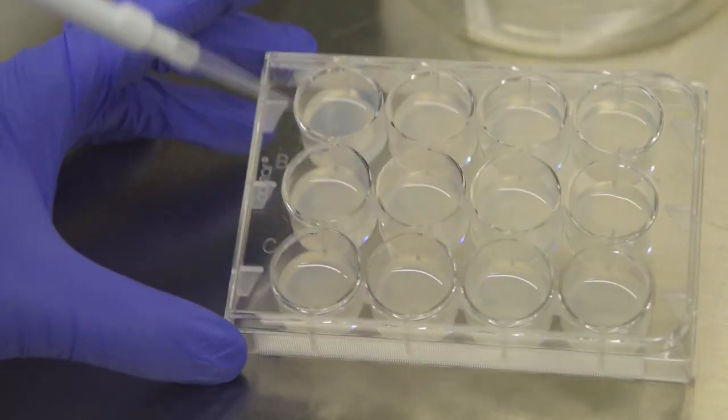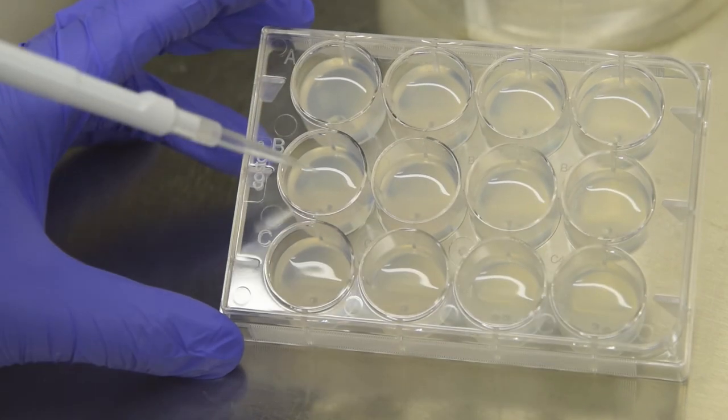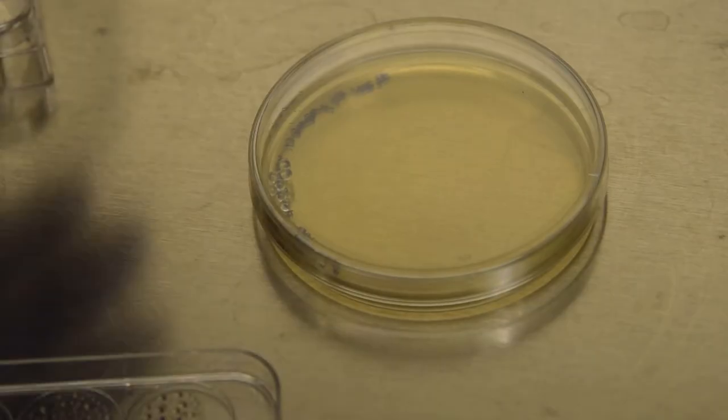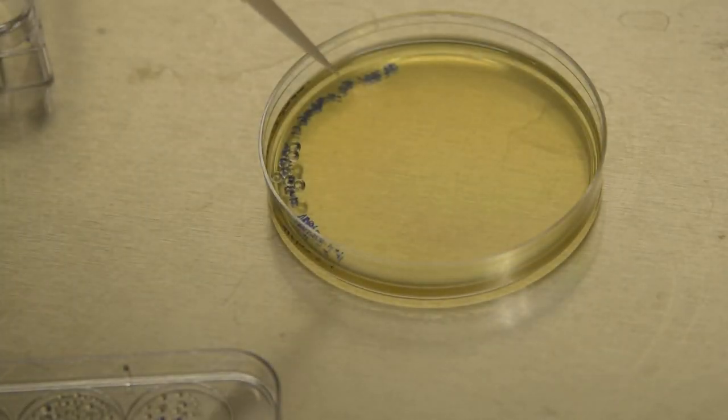Take care to not damage the agar in the wells. Shake the plates to evenly spread the cells across the surface.